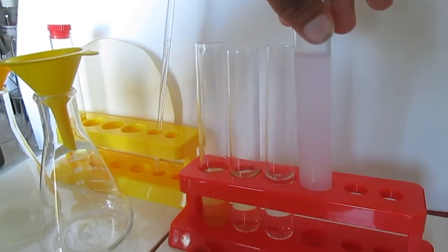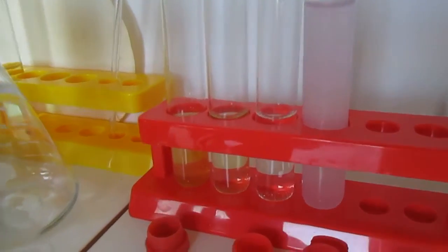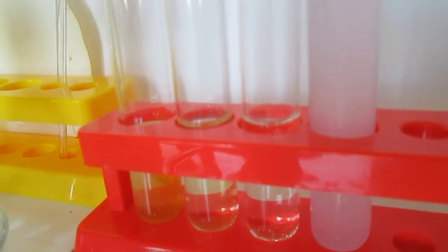In this fourth test tube I made a solution of sodium carbonate. It is a cloudy white solution. We first add citric acid to the ammonium iron sulfate.